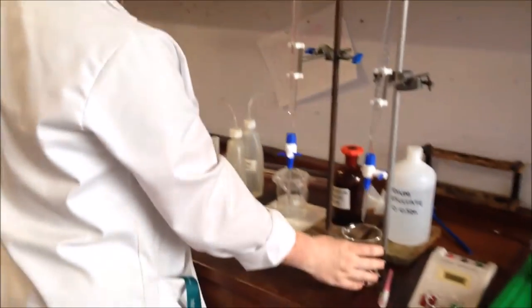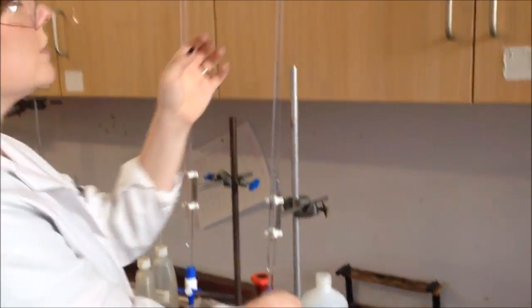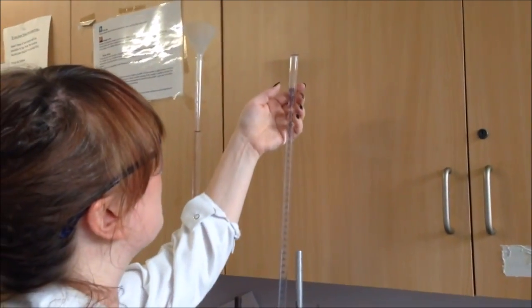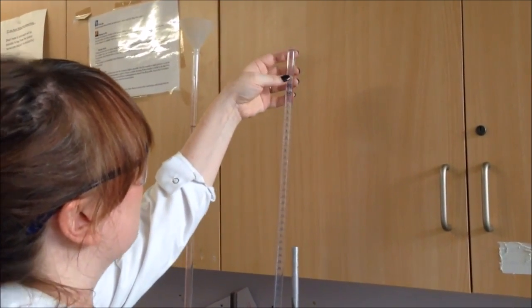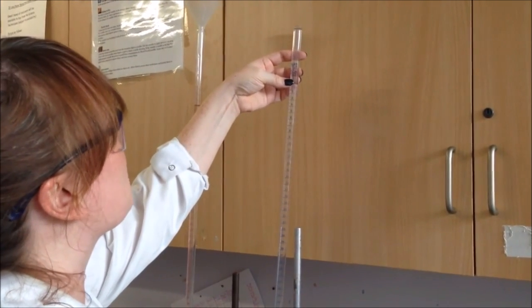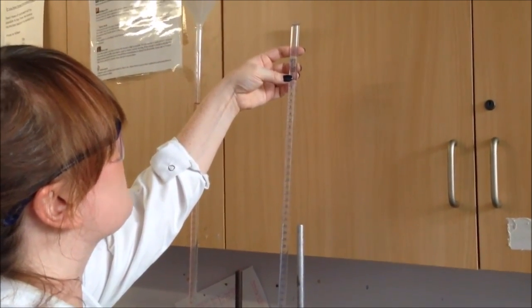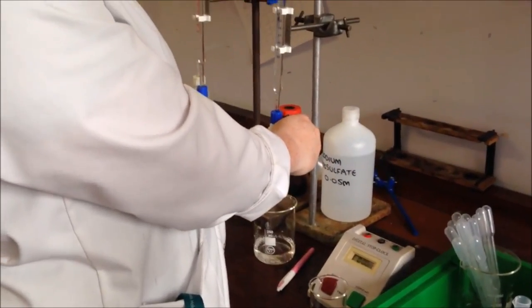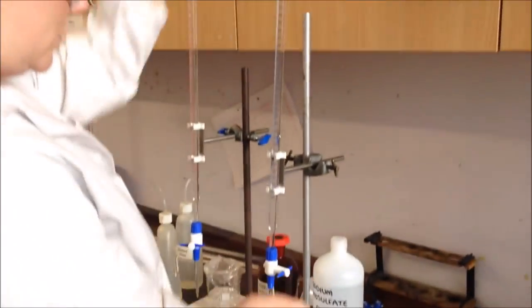After the potassium iodide, I need 5cm³ of sodium thiosulfate, so in exactly the same way. Now I want to stop.